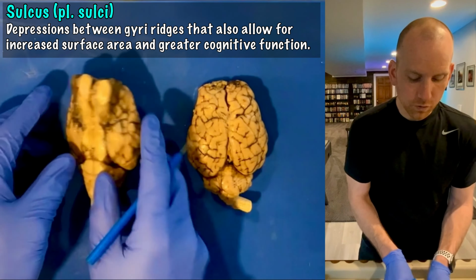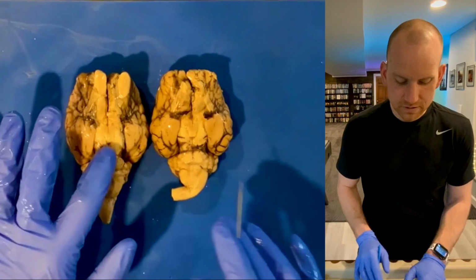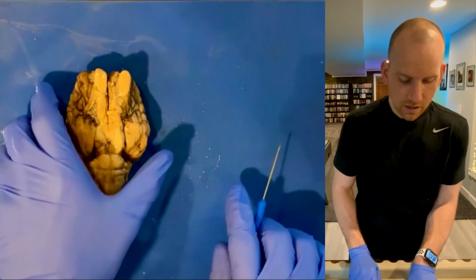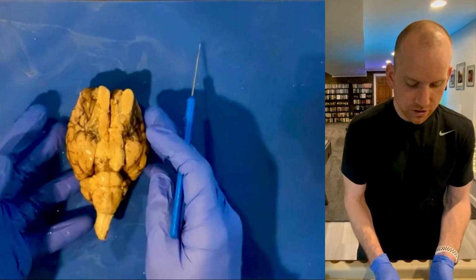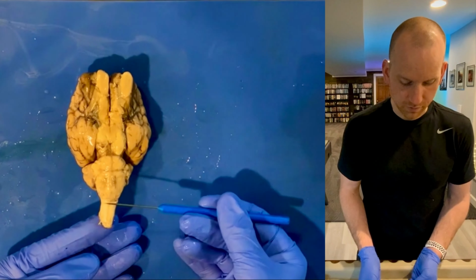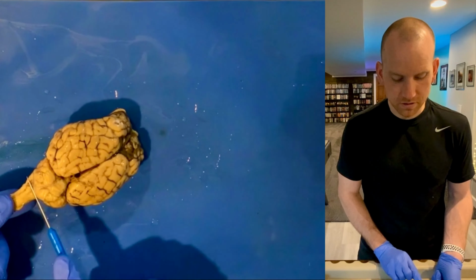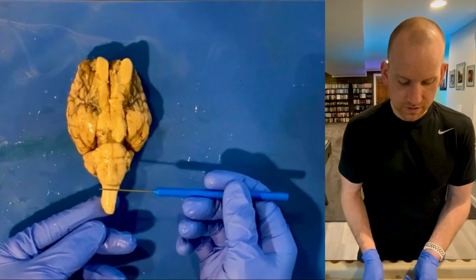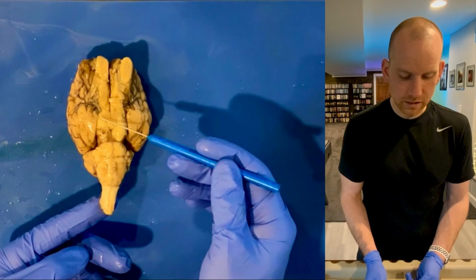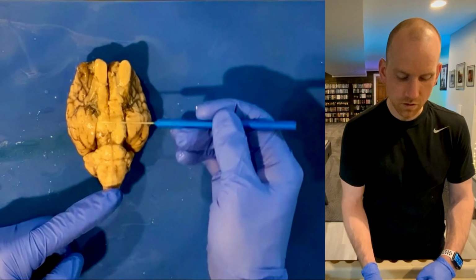If we flip the brain over, though, there's a bunch of other features of the brain that I do want to show you on the back. This brain seems a little bit better than this one, so I'm going to actually focus a little bit more on this one. Right here on the underside of the brain, well, actually, let's talk about main regions. So from here down, you can actually see there's a little bit of a color difference. Anything below the cerebellum, so if you find the cerebellum and go to the bottom of the cerebellum, anything below the cerebellum is now spinal cord. But above that cerebellum, where you get to this lower portion of the brain right here, from here to here, right, all of these structures are actually part of the brainstem.